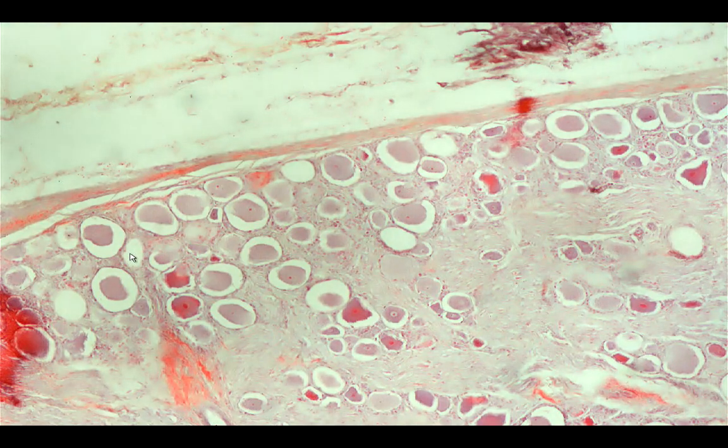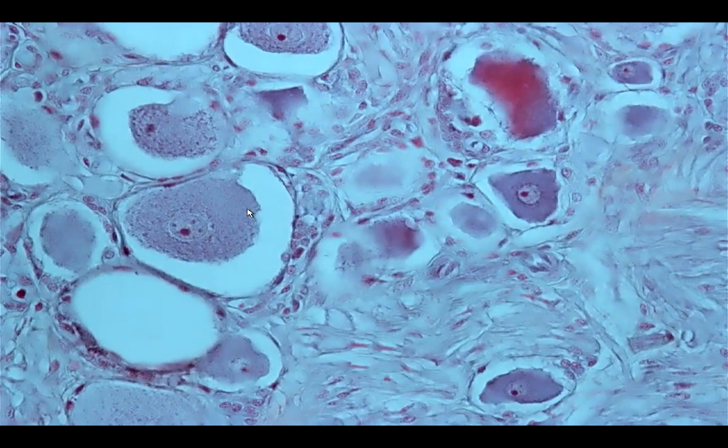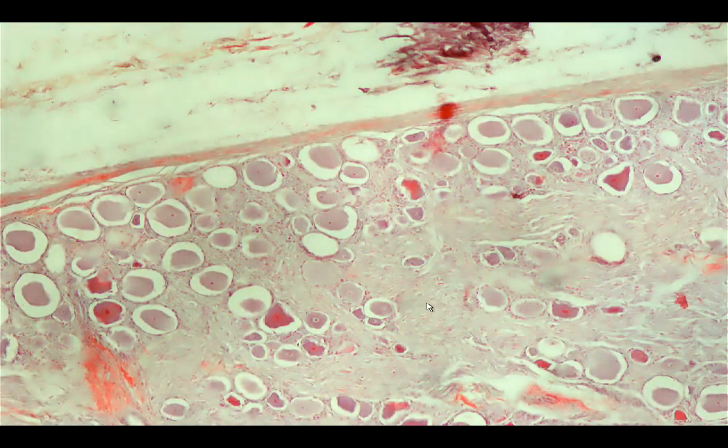Let's try to look at the longitudinal section of the spinal ganglion. Okay, and this one would show a better view. So you have a lot of those ganglion cells, prominence of the nucleolus. They would possess a pale nucleus. Okay, you see a lot of those lipofuscin pigments there in the cytoplasm, and then you have the presence of the satellite cells. Nerve fibers are present in a longitudinal fashion.